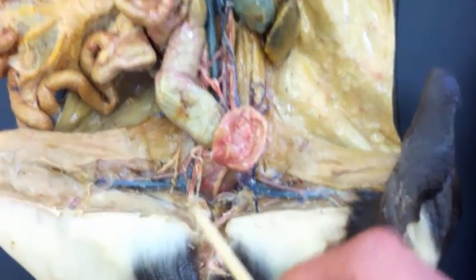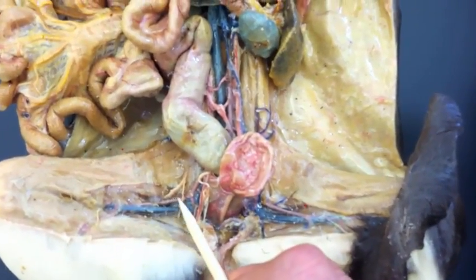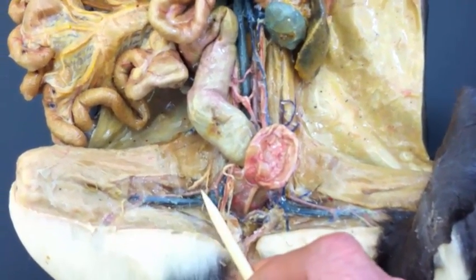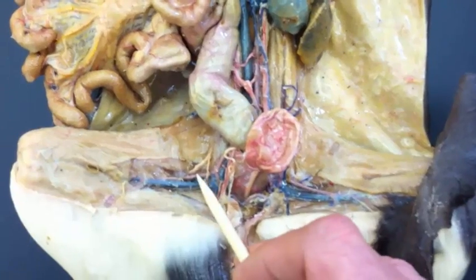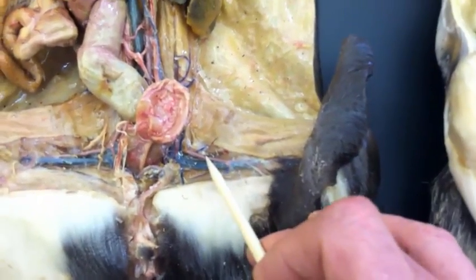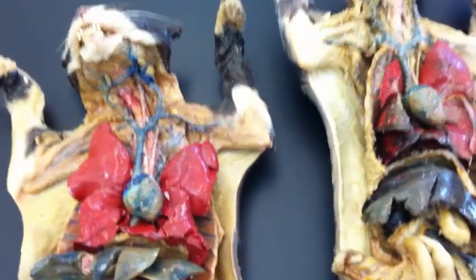And then again, getting down into the legs, what would this be then? The answer there is the right, in this case, femoral artery and right femoral vein. And over here we have left femoral artery and left femoral vein. Okay, that's a lot of stuff. You'll notice in my lab I usually have multiple models. And the reason that I do that is I know if my students can recognize it on 3 or 4 different models that look differently, hopefully they'll be able to recognize it on a real human later if they have to.